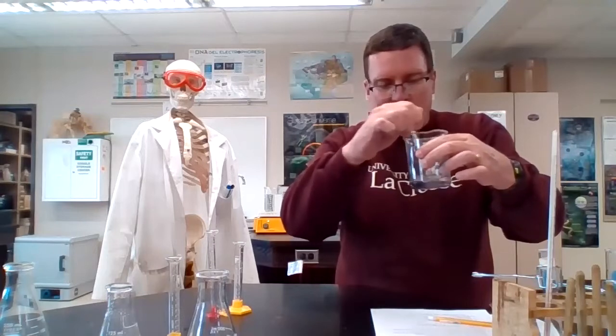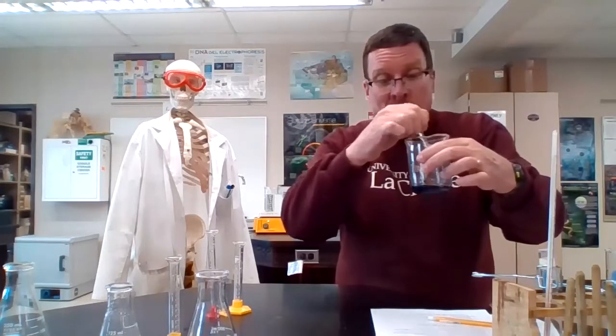And there we go. We are at 70 seconds right on. So I like that. That's good. So our room temperature, 20 degrees, was 70 seconds. I'm going to pause for a minute and set up the next reaction, and we'll be back. So stay tuned for the excitement.